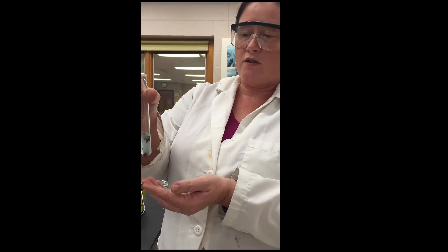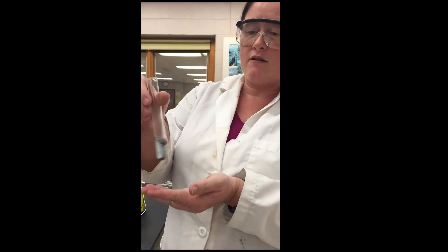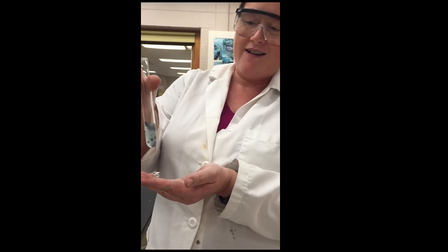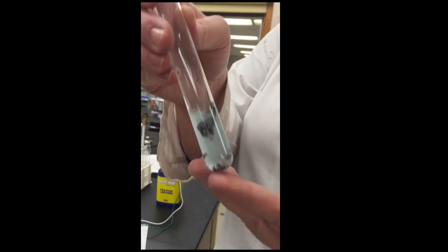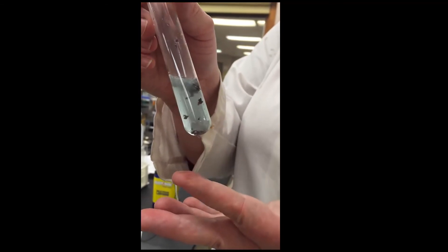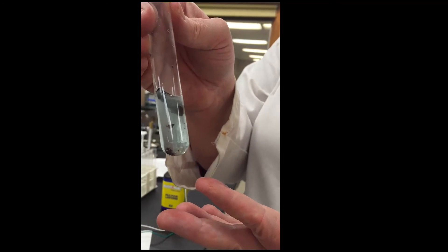You can see that it has already turned less of a blue color. The reaction is speeding up quite a bit, and more and more copper chunks are forming, floating at the bottom.